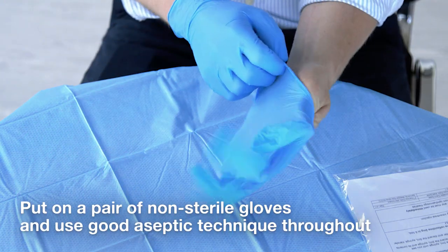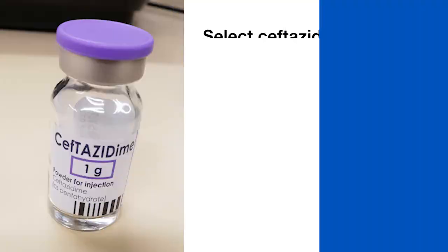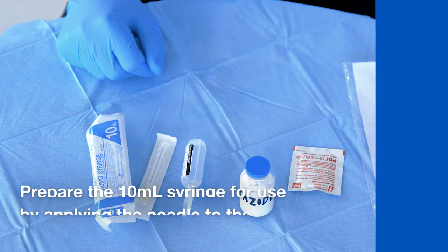Put on a pair of non-sterile gloves and use good aseptic technique throughout. Select ceftazidime 1 gram dry powder vial. Caution: ceftazidime is also available in a 500 mg, 2 gram and 3 gram vial. Check that the vial strength is 1 gram before preparing the dose.